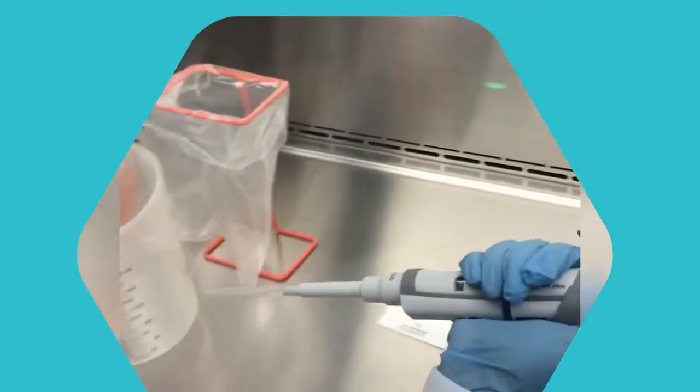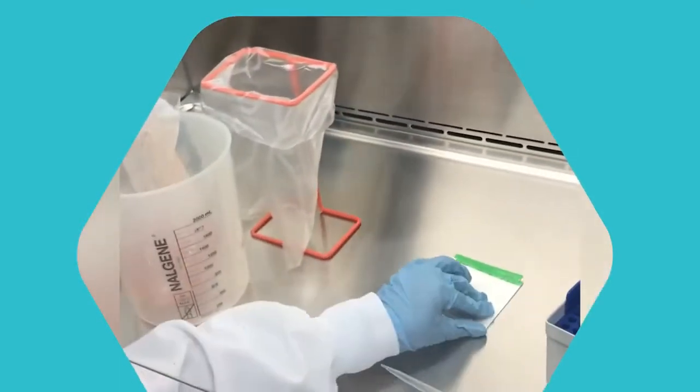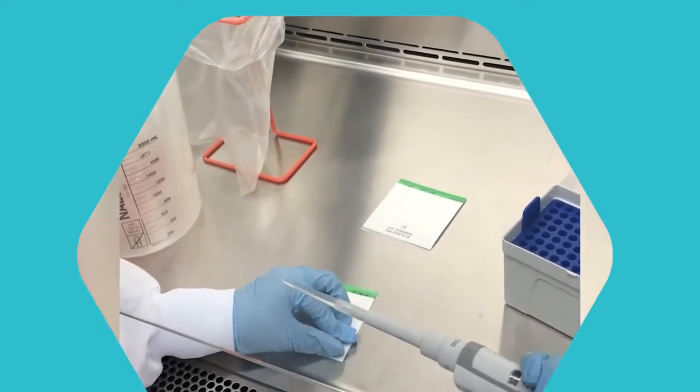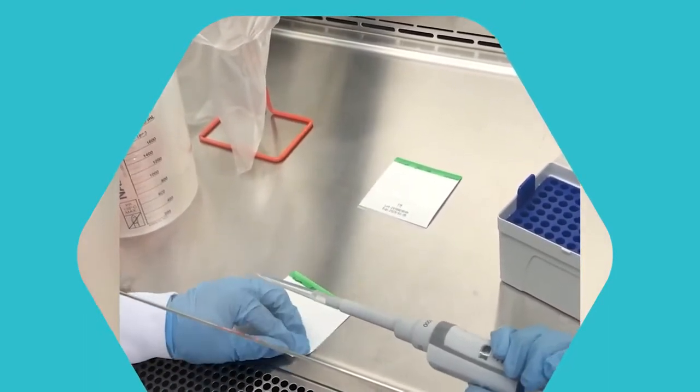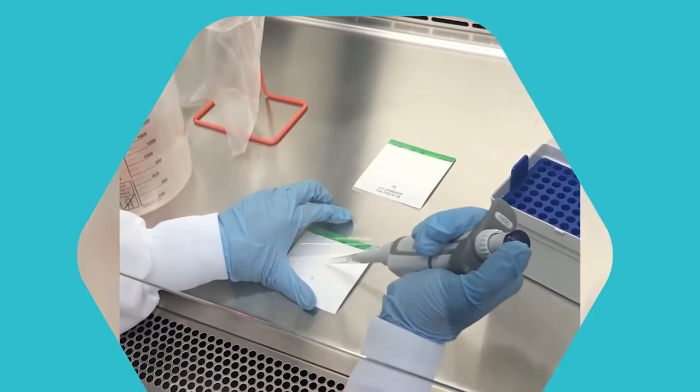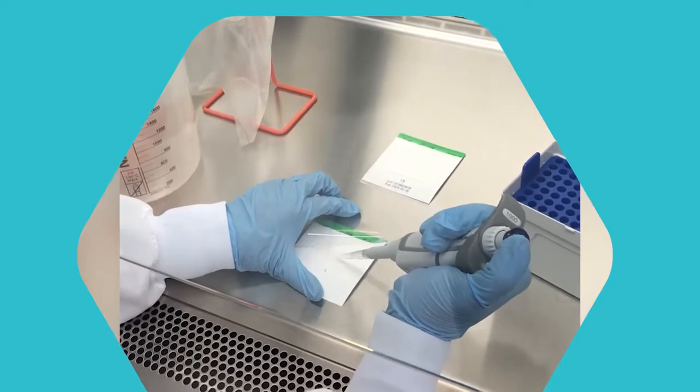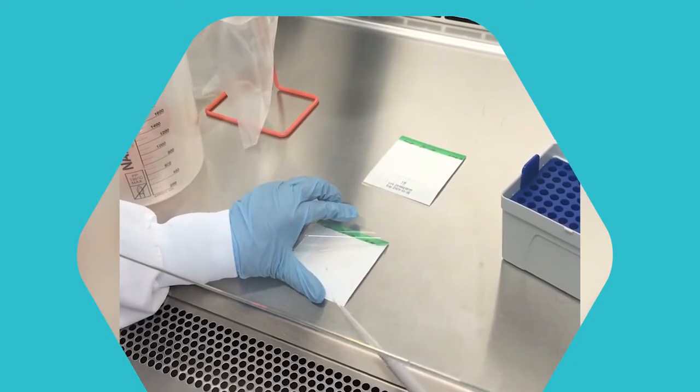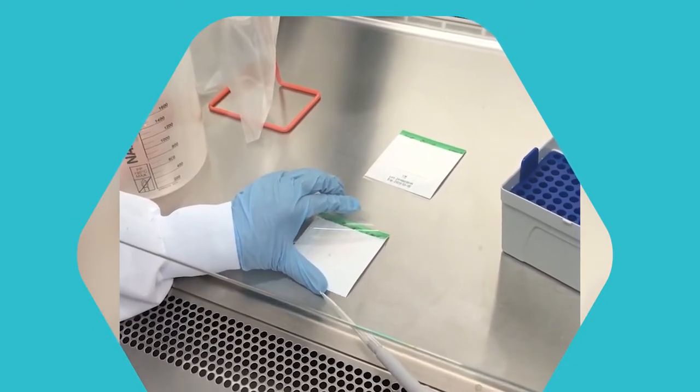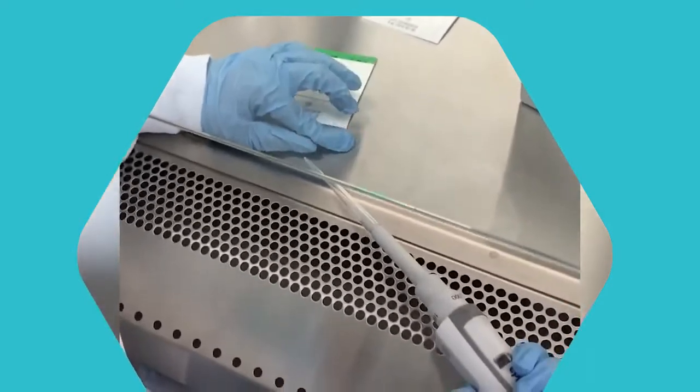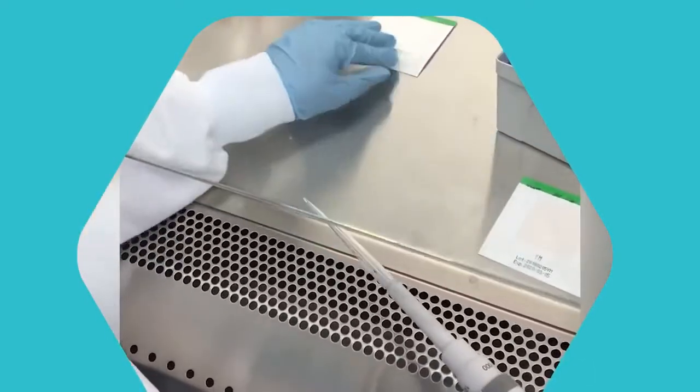Here we go. And we have the other pad. We're going to do the same thing. We're going to put our solution right in the center and let it absorb. And then this will go on the side too.